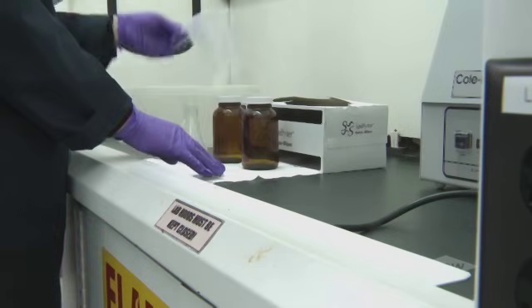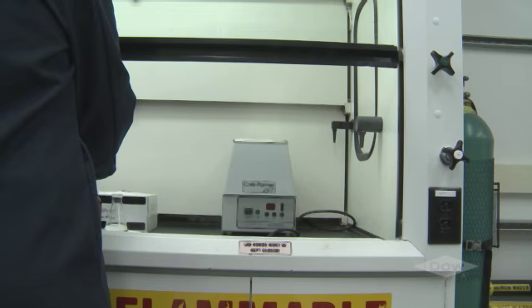Here Heather shows us the airfoils at the bottom and sides of the sash opening. They significantly reduce boundary turbulence and improve capture performance for the fume hood. This helps make sure air flows into the hood in a smooth manner to pull contaminants into the hood and away from the user.